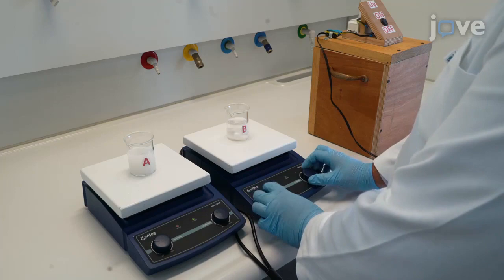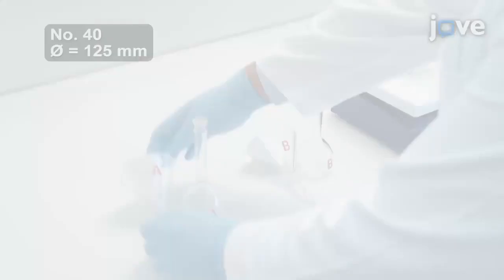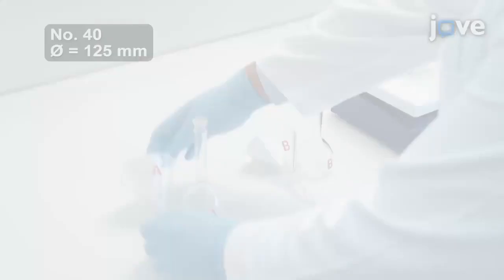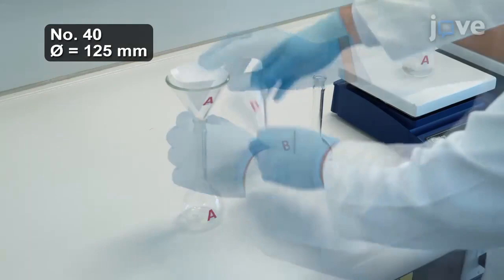Turn on the UV light source and allow the reaction to proceed for two hours. Immediately filter each solution from beakers A and B into separate flasks.